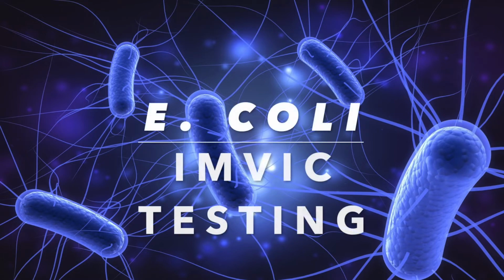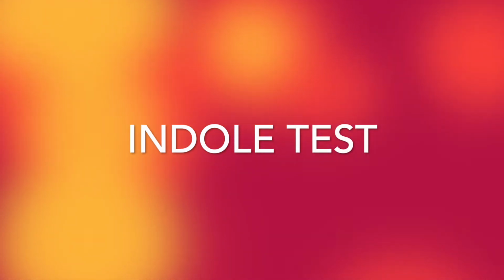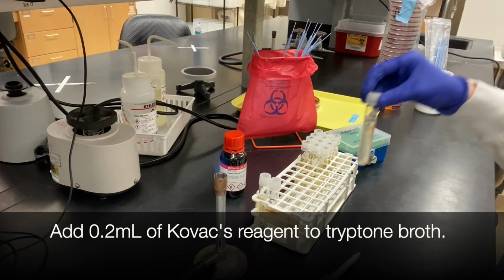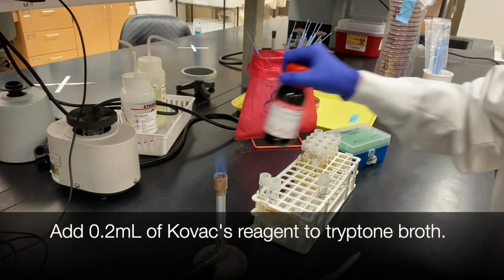In this video, we're going to be discussing IMViC testing with E. coli. For this experiment, we're going to be on day 2, which is after 24 hours of inoculation. Add 0.2 ml of Kovac's reagent to your tryptone broth tube.